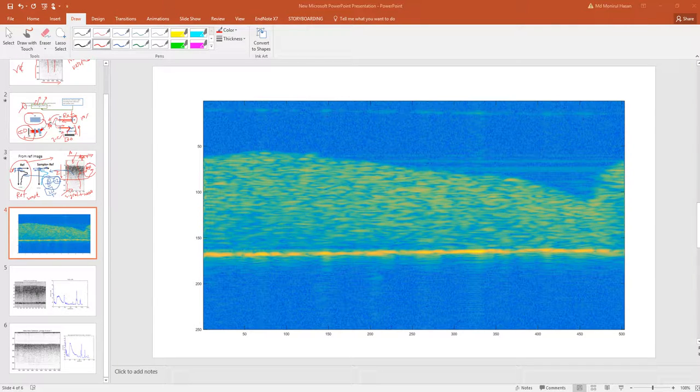I will explain another way to subtract noise, where in the image we see particle streaks, something like that, if the image is not homogeneous. If you take the image, say this is your sample, this is actually a brain slice image. We took the image of the brain slice by putting it on top of the multi-electrode array, MEA.